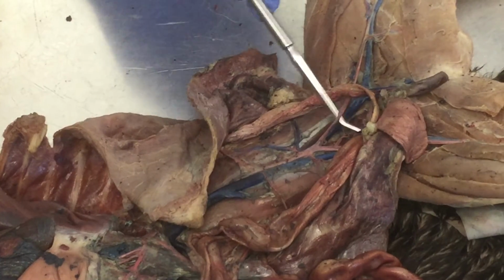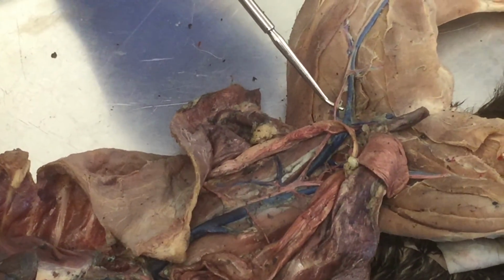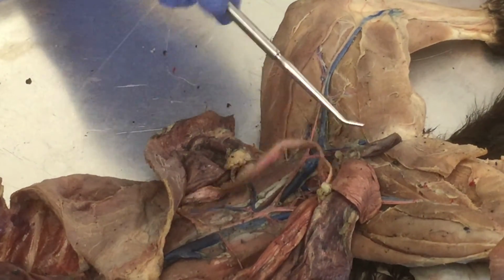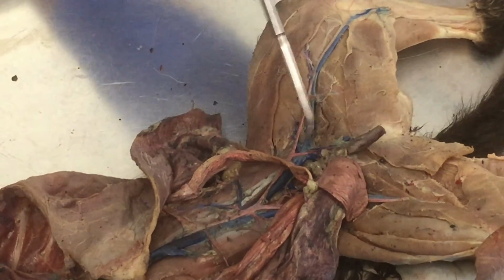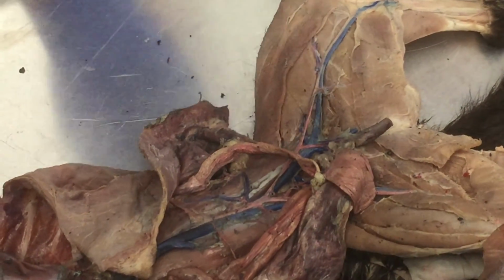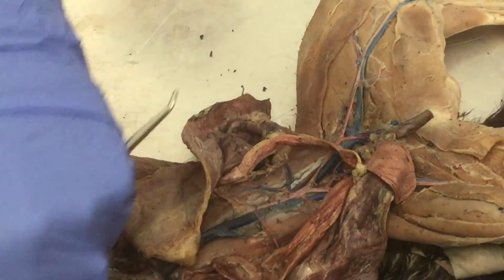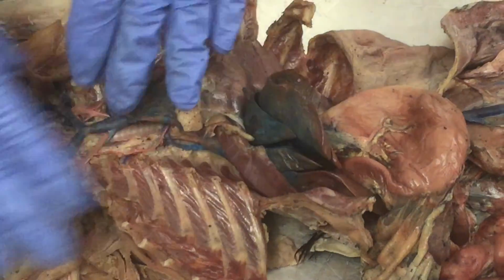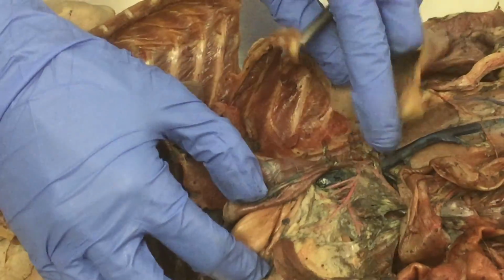Okay, so then external iliac passes the body wall and becomes femoral, okay? And then deep femoral, I said right along the groin region, right here diving medially. So artery vein combination, deep femoral. Okay, and that's it. So let's start with azygos on the right. So just get out a little bit of it, and then everything else we need to go to the left, skin the diaphragm back, and then start looking for celiac trunk.